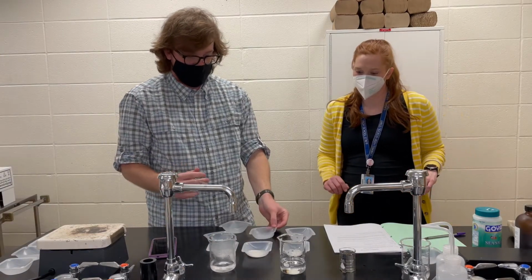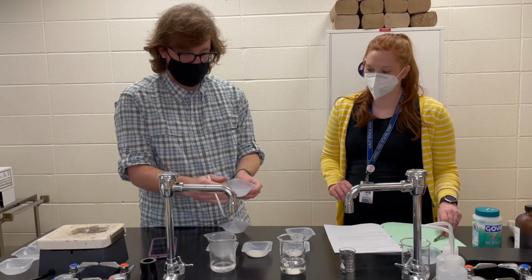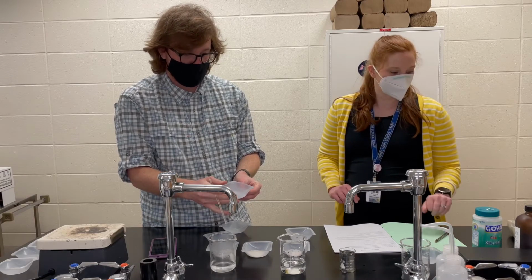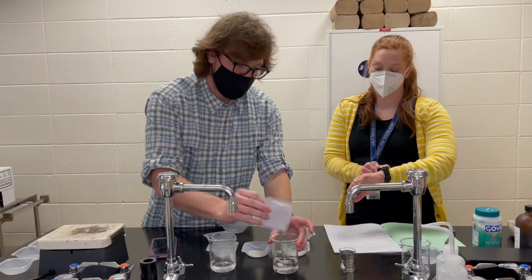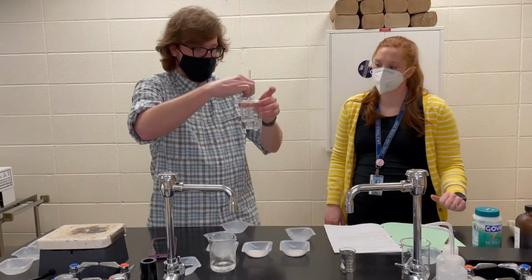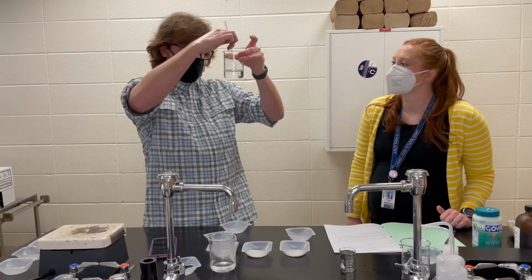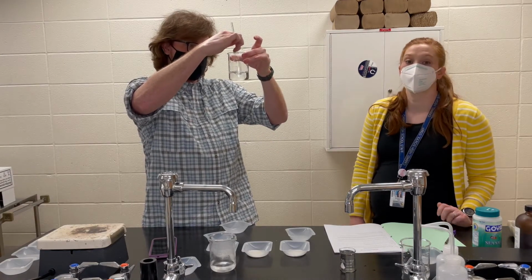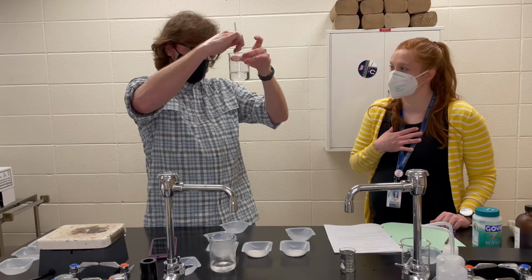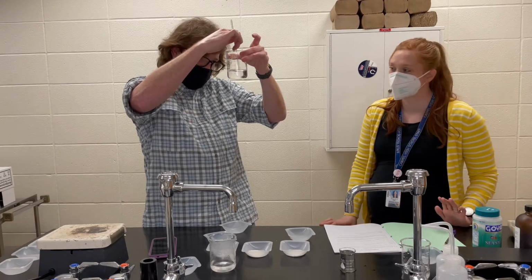We're gonna go ahead, dump the same amount of salt, exact same, into our room temperature water. Okay, I'm ready. You ready for me? Dump that in, and then I'm gonna start stirring. Again, trying to keep as much similarity as possible, so I'll stir with about the same speed, which is why I am not taking over the stirring duties. We're gonna keep that a consistent variable here.